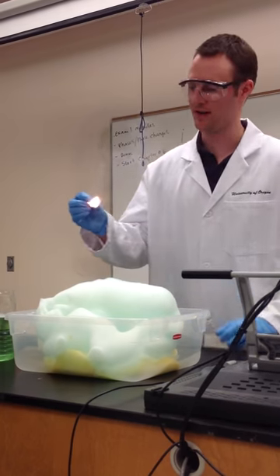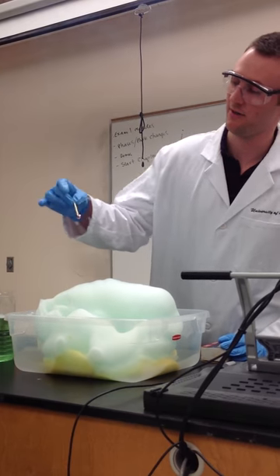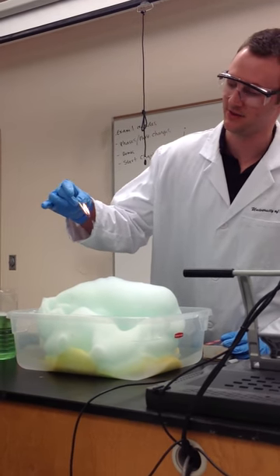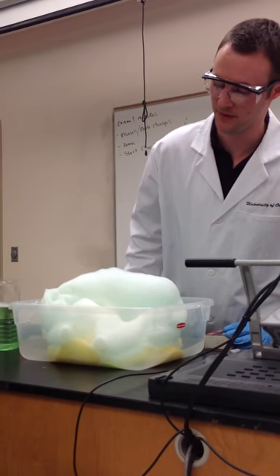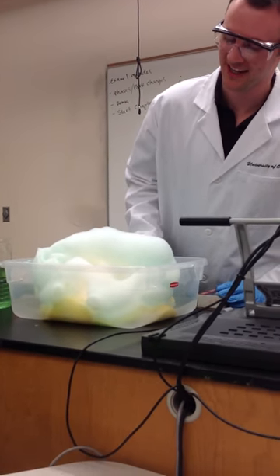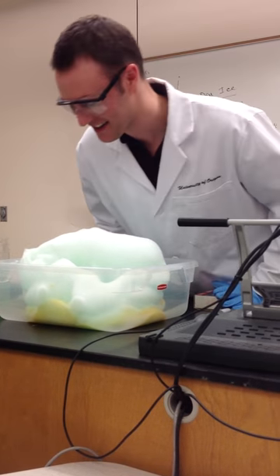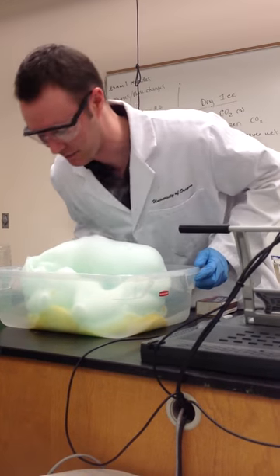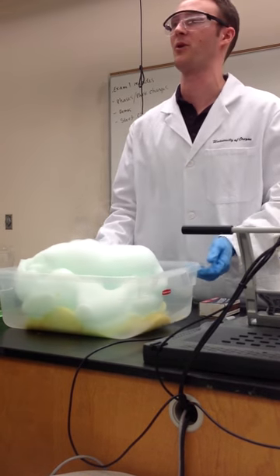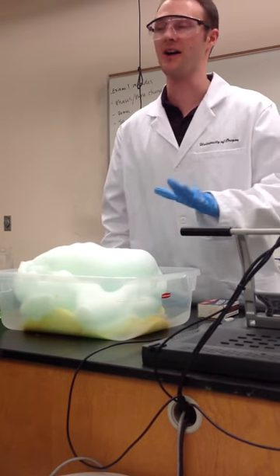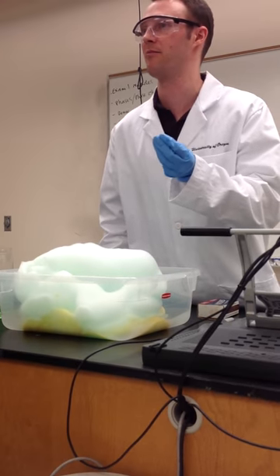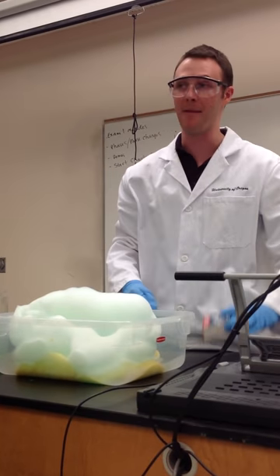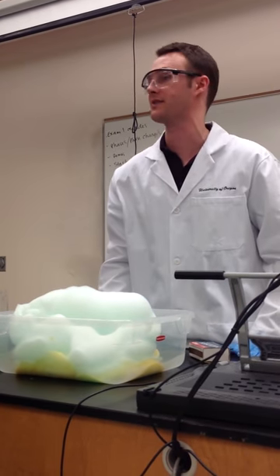And every now and again, it looks kind of cool. If I can get it to work. Sorry, all the matches. Because if you drop this sucker in, sometimes it's cool. So, let's see what I do. So, it just kind of burned a nice hole through here, and completely burned the match. It's just a big hole going through the foam now. So, yeah. So, oxygen just helps things burn. It does not burn. And you didn't, this whole thing didn't go. It just helped my match, which can burn. It just helped it burn faster. It was all.